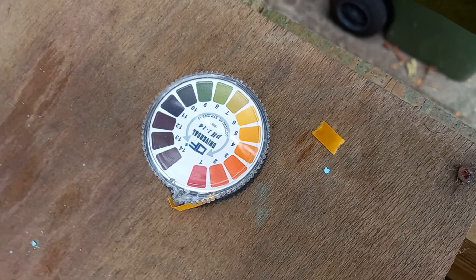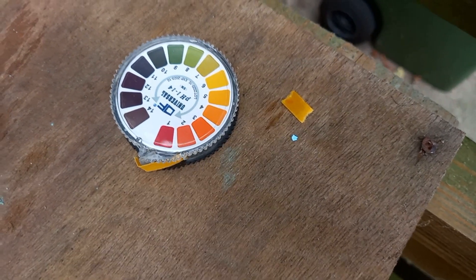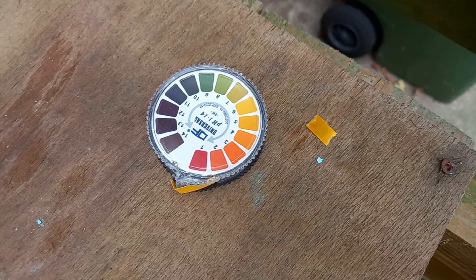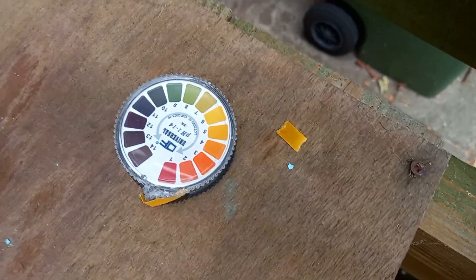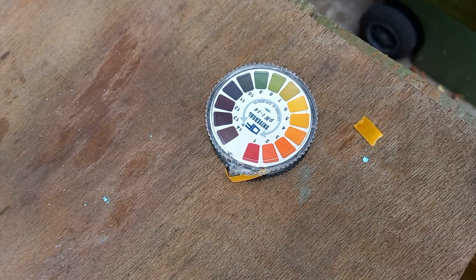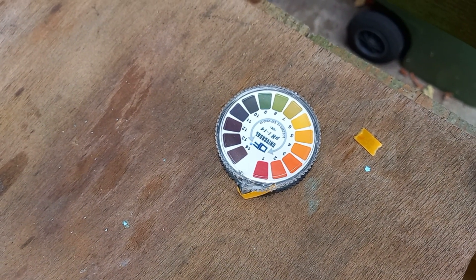So the pH tested slightly acidic, which is weird. Probably just bad pH paper. But anyway, it probably just means it's neutral, because it can't really be acidic. So that means I got my stoichiometry right.